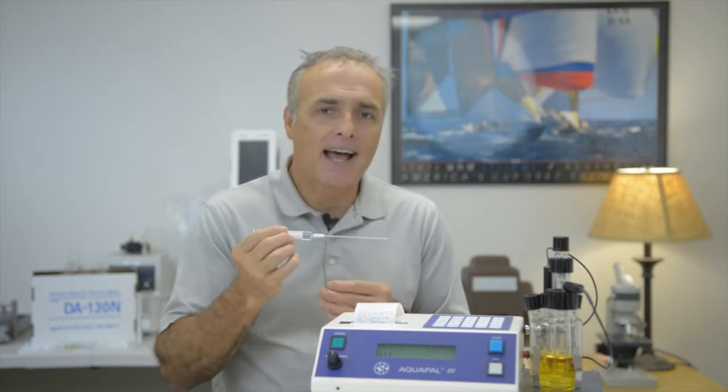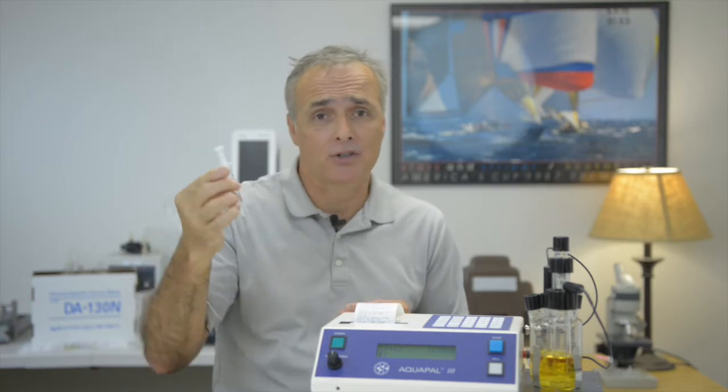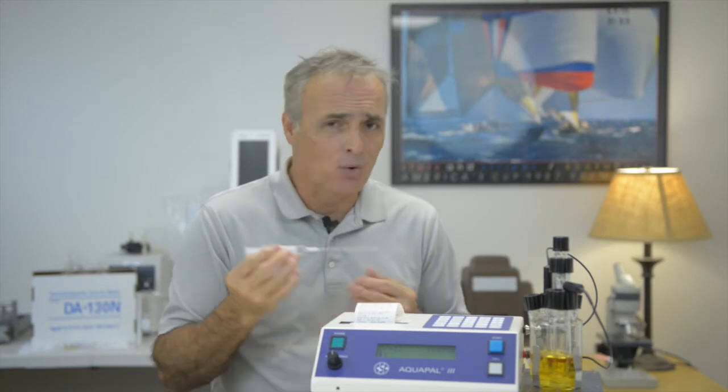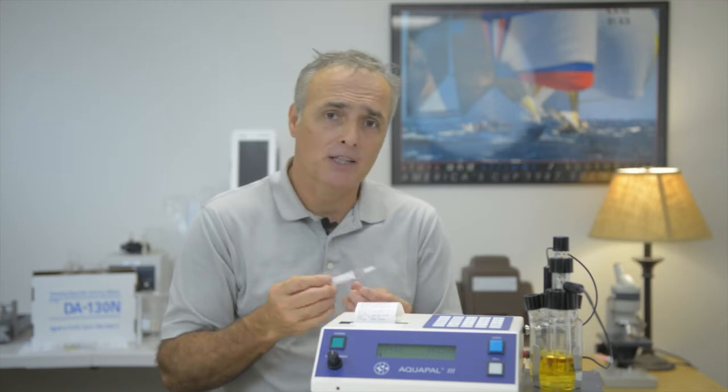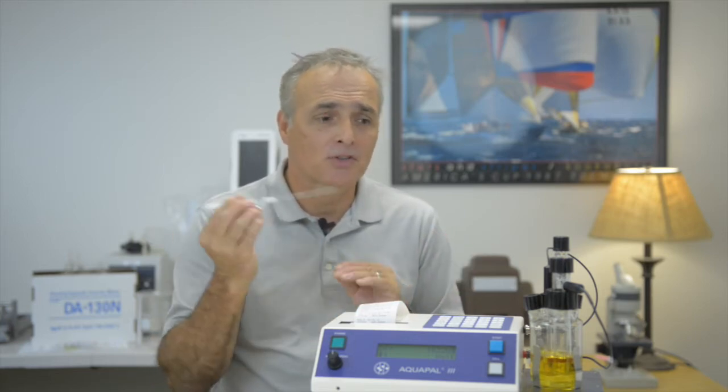It's pretty straightforward. The pros and cons: you need to have a good syringe, something where you're confident that you're actually getting 1 mil in there, because it's based on the volume, and we're really eyeballing that volume. It's really what we see. There's no way to measure it other than to visualize that 1 mil is there. Obviously, if it's a 1 mil syringe, yes, but you could have some in the headspace of the syringe. So getting the right volume is important. The test just finished. And knowing the specific gravity, that's the other piece of information. If you have those two, you're able to do this very efficiently.